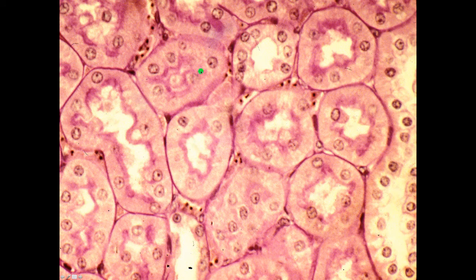And again, some views of proximal convoluted tubule. You can see the PAS positive nature of the brush border. This probably a distal convoluted tubule. Look, you can see more cells around the area of the distal tubule. The cells are a little bit smaller, so you see more nuclei. Here on the extreme right may be a profile either of the distal convoluted tubule, but more likely part of the cortical collecting ducts. And I'm making that comment on the fact that I see some distinct cell boundaries here, whereas in the proximal convoluted tubule cells and in the distal convoluted tubule cells, the boundaries are not distinct.